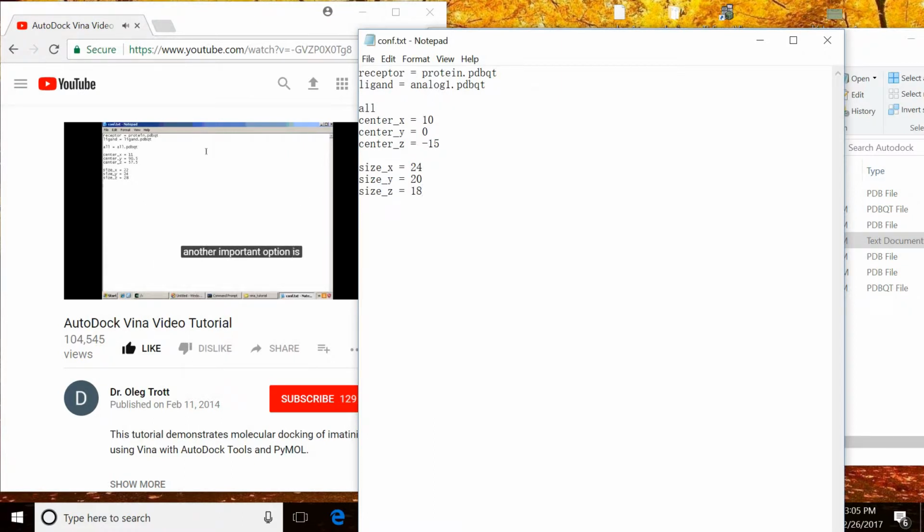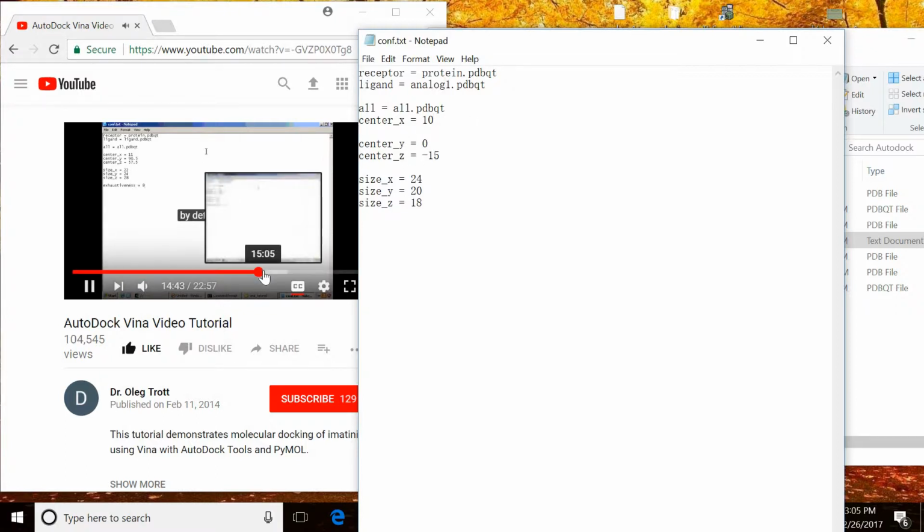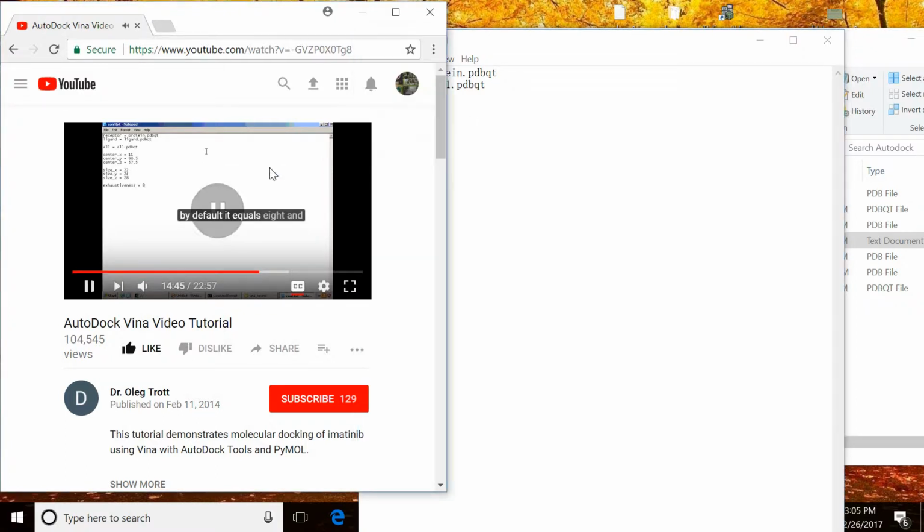Another important option is exhaustiveness. By default, it equals 8, and exhaustiveness determines how thoroughly Vina searches. You can use the defaults in most cases.